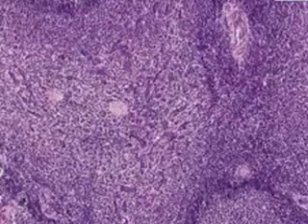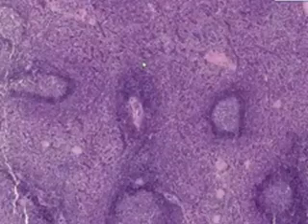And I'll ask you this question again. Now that we have gone through all these structures, is there anything on here that you couldn't identify if you had to? No, because we've identified everything. Capsule, red pulp and everything associated with it, trabeculae, central arteries. I'm sorry, this is white pulp. The rest of this is red pulp. The sinusoids within the red pulp, and all of the various types of cells that are doing their job within the spleen. And I thank you very much.